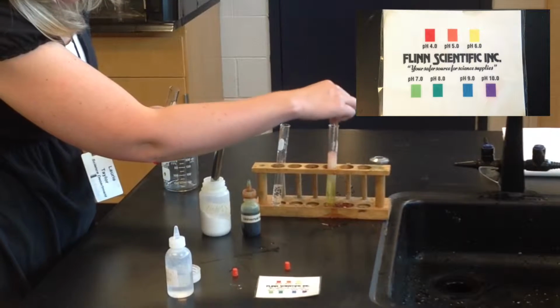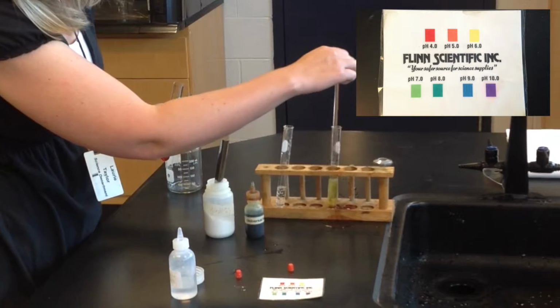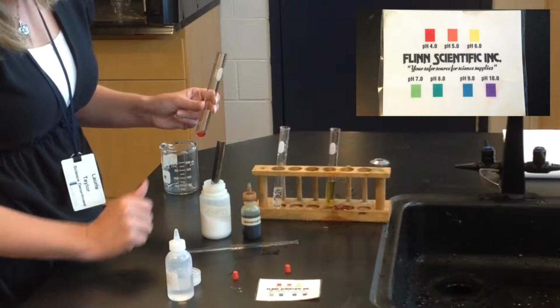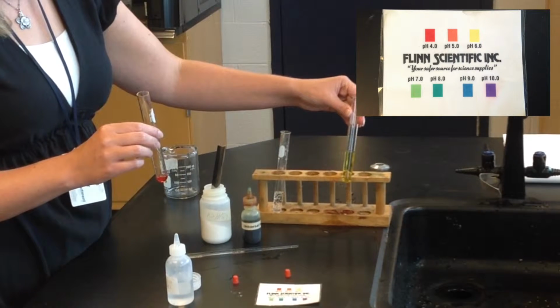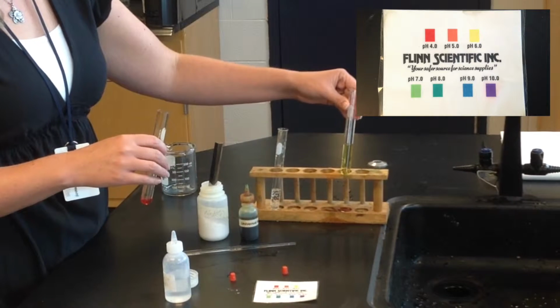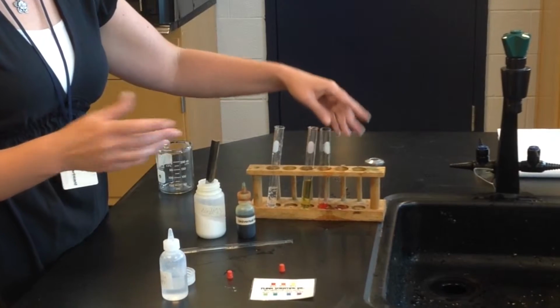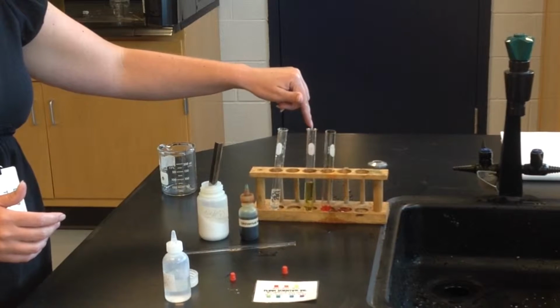It eventually gets to a kind of a light green color, which indicates that we've just about neutralized it. And it's actually a little beyond neutralization. We added a little bit too much acid, and so we went a little over the neutralization, went a little more acidic. But you can definitely see a color change in our indicator, which shows that we've had a change in pH, which is more evidence that a chemical reaction has occurred. Now you could do this reaction just as easily with baking soda and vinegar and get the same results. And in fact, it's a little bit easier to get a good neutralization and get this to a good light green color.